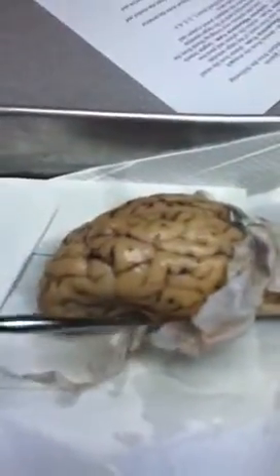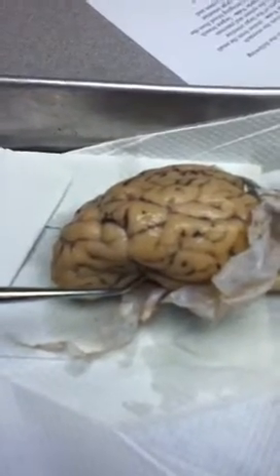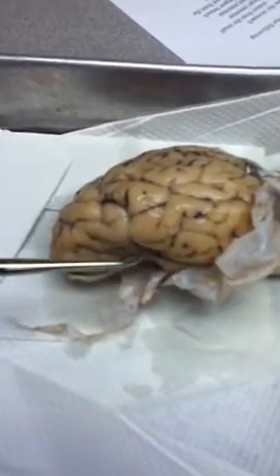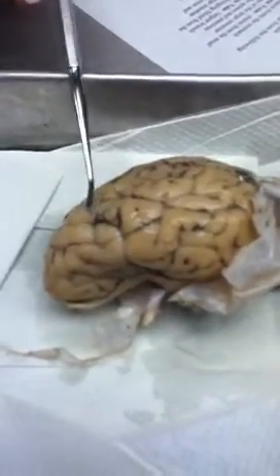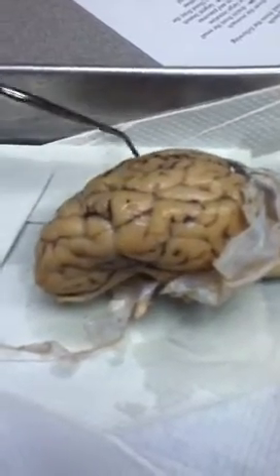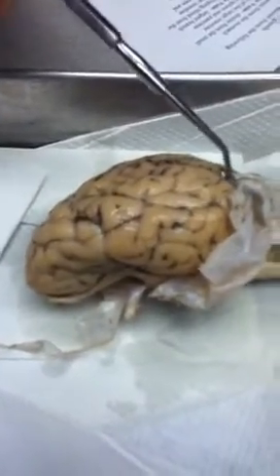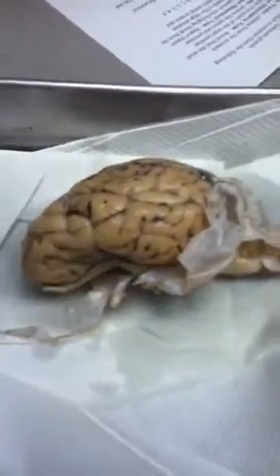Okay. Longitudinal fissure. Lateral. Is it lateral or transverse on your list? Either way. Lateral, I think. And then this here is your central sulcus. Okay? Frontal lobe, parietal lobe, occipital lobes are in the back, and temporal lobes are on the side. I'm sorry. The central sulcus is the indentation, right? Yes, this indentation right here. Okay.